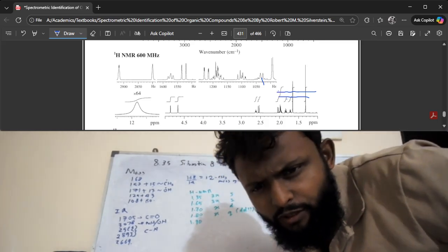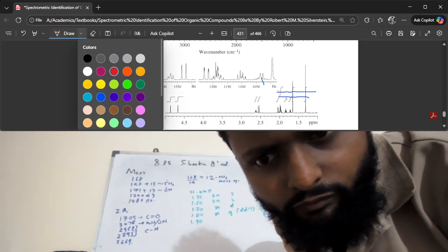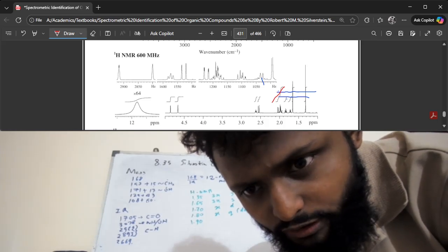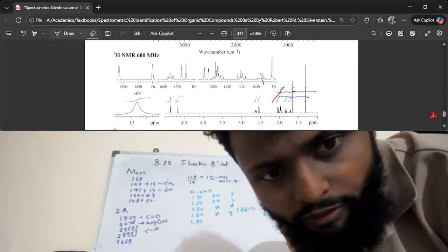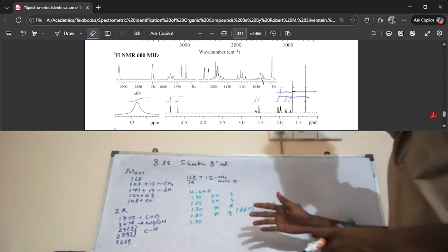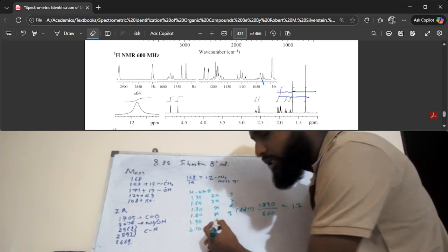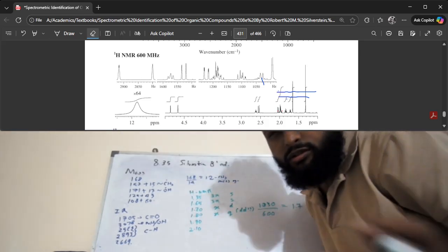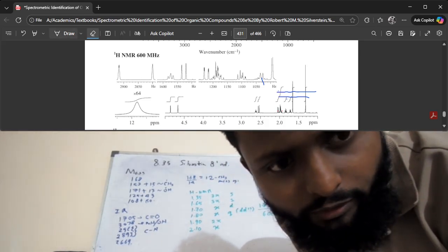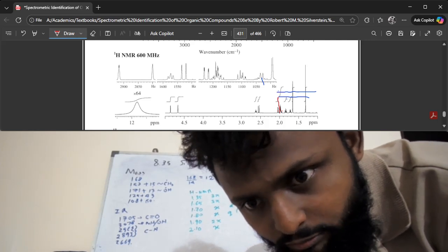The next one is the 1.9. As you can see, there's only one integral that goes over this entire range, and that one integral spreads over two signals, this one and this one. So we'll have to figure out the relative heights of the proton density that correspond to those different signals. There's one at 1.9 and the other one we're going to say 2.10. These are approximate numbers. The integral seems to indicate x for 2.10 and then 2x for 1.90, because if you consider this line, from this line upwards, it stops at 1x height. So the remaining 2x height must correspond to 1.9.